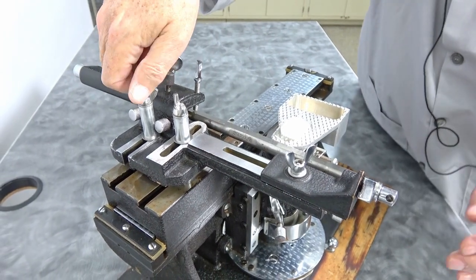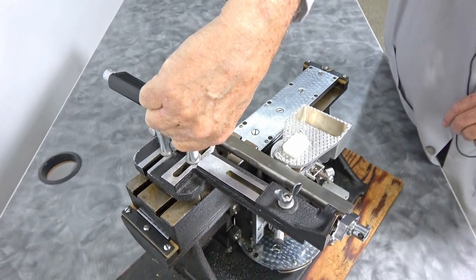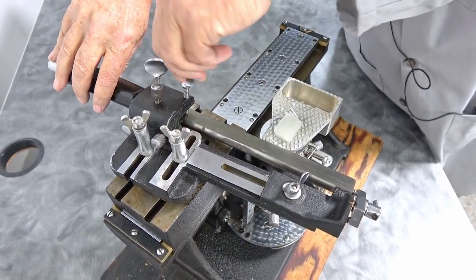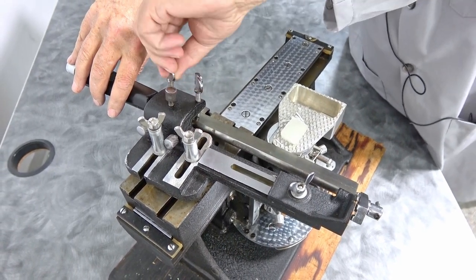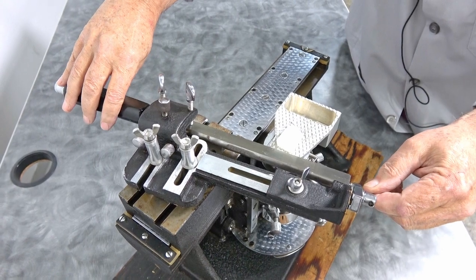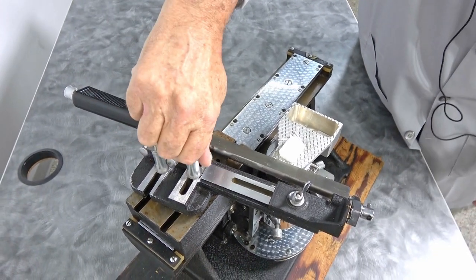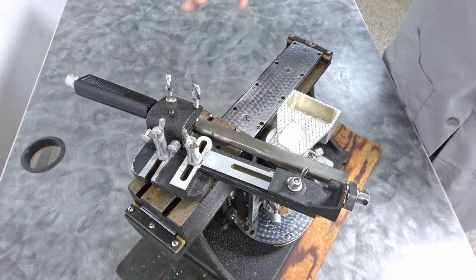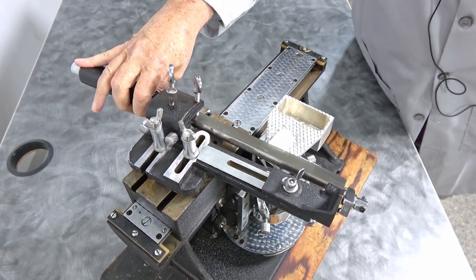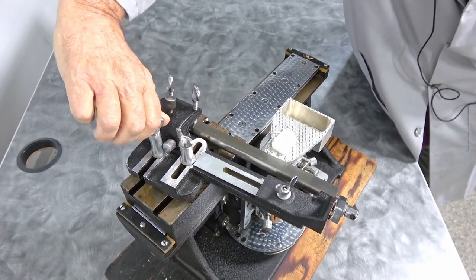You can change your angle of attack and you should tighten this down before doing that. So you can change your angle, tighten it down and then you're going to cut a little different angle onto it. Of course I've done all that moving, so tighten this down.